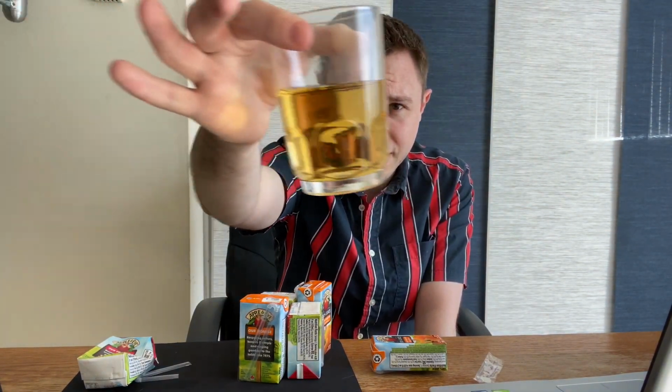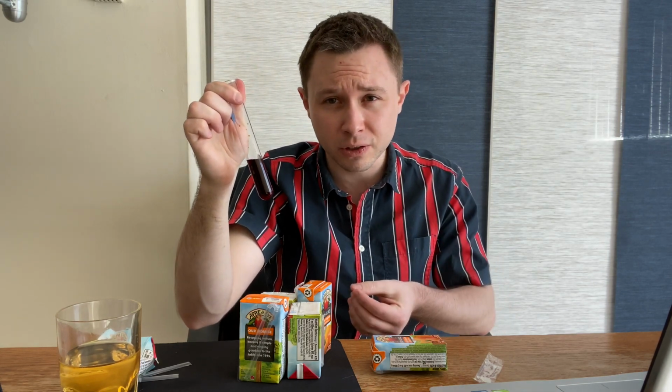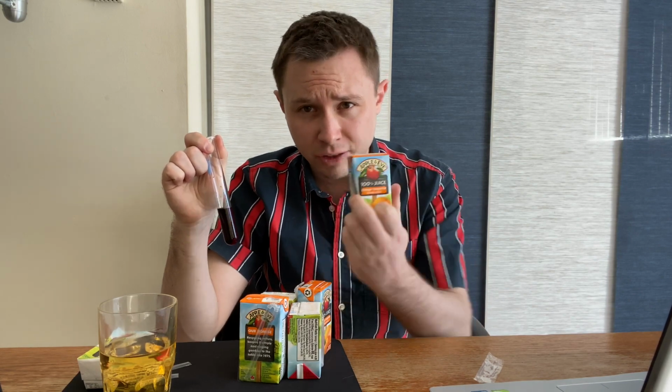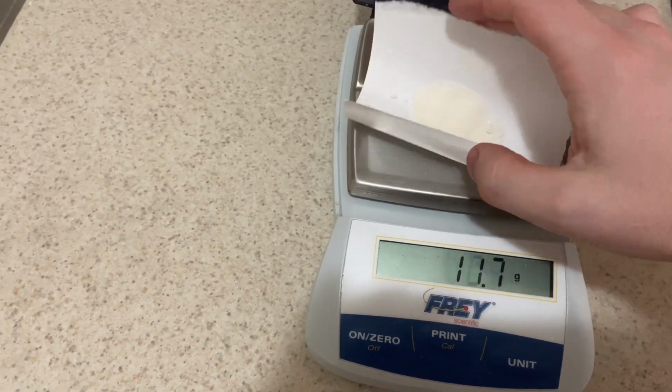Alright, now I'll bet, just by looking at this juice, you couldn't tell me how much vitamin C is in there. I mean, you can see the juice, but you can't see the vitamin C chemical. That's where this comes in. Iodine indicator. Indicators in chemistry change color when they're exposed to certain chemicals, allowing us to see chemicals such as vitamin C that we normally would not be able to. And that's going to be really key to answering that question of how much vitamin C is in these juice boxes. Take a look.